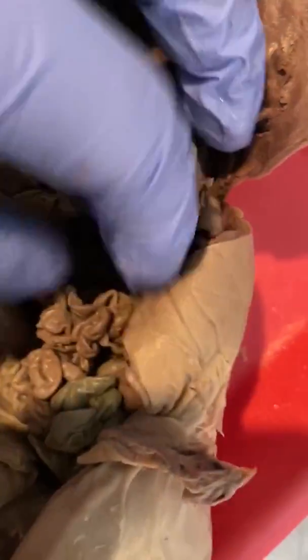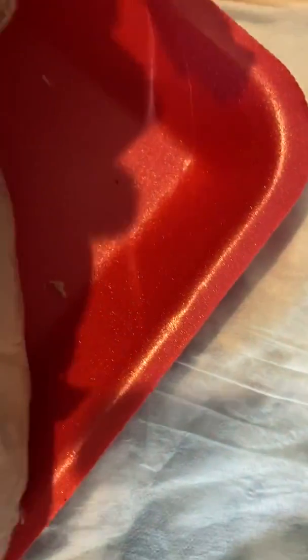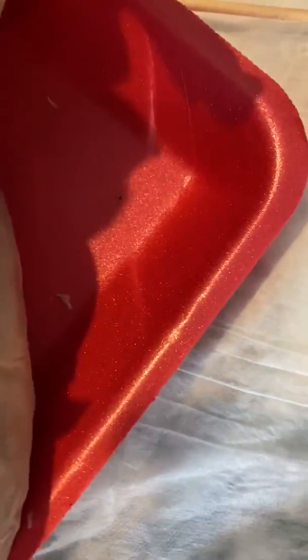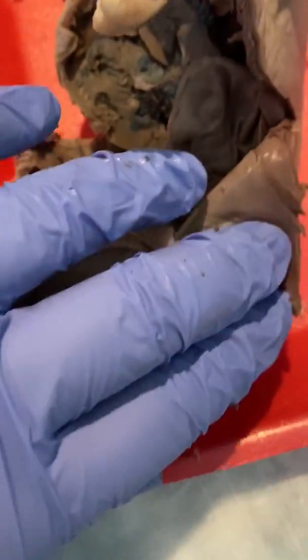And then the duodenum, that's the top part of the small intestine. And then the pancreas too was tricky for me to find. It's right under the stomach. Let's find the stomach here, but I think I did find it. It's kind of a weird texture. Right here. And I think that's it.